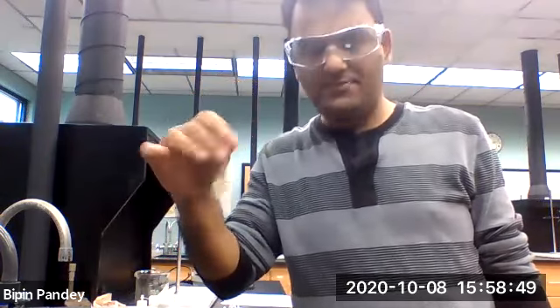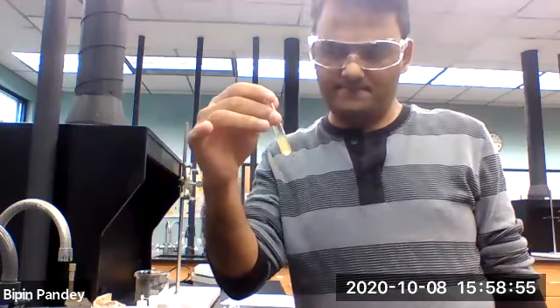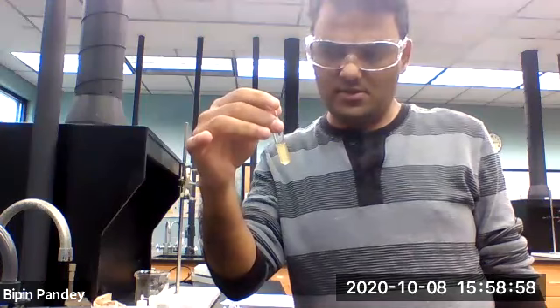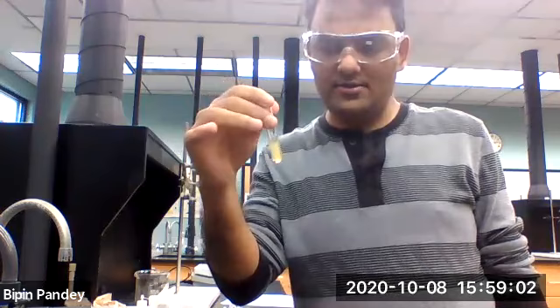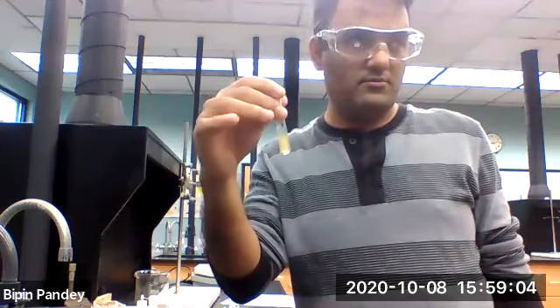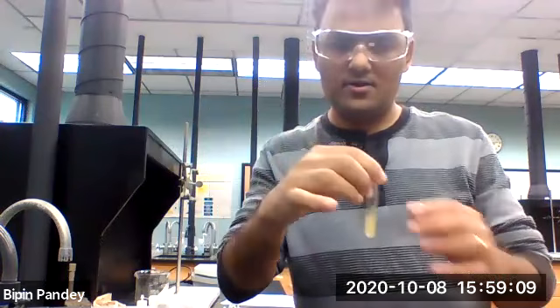So that pretty much wraps up the lab. So please fill out the lab, record your observations and then draw a conclusion. So that's it for this solubility table lab.